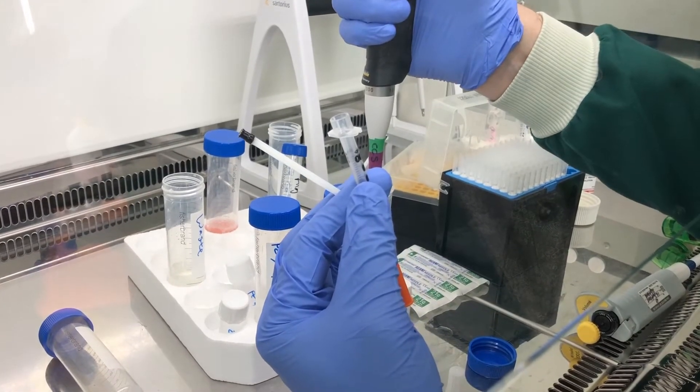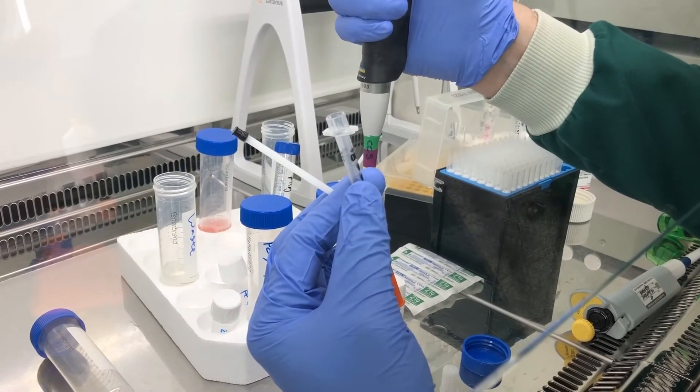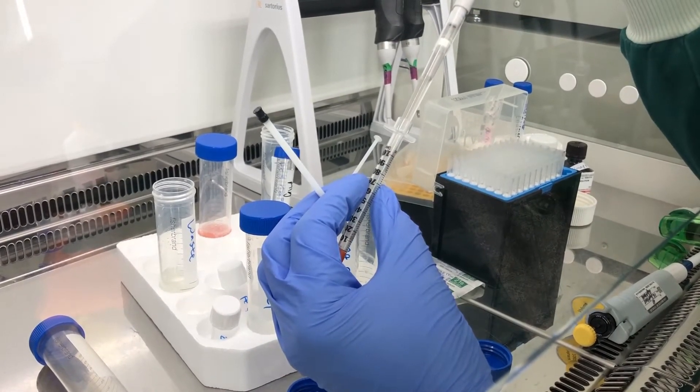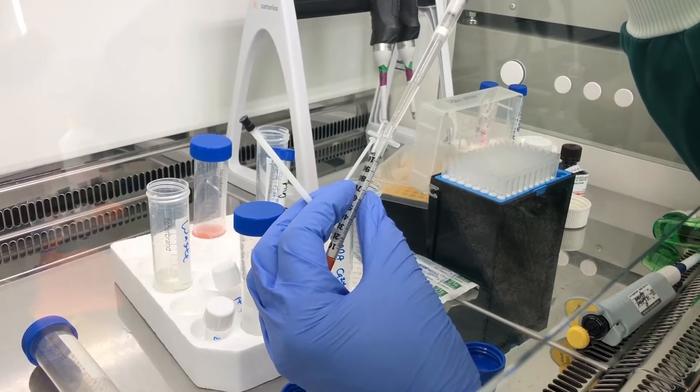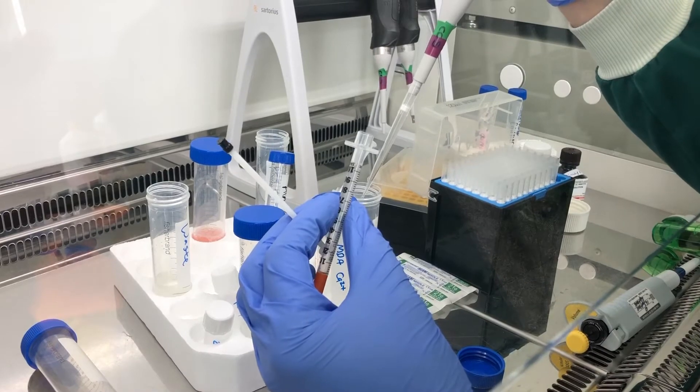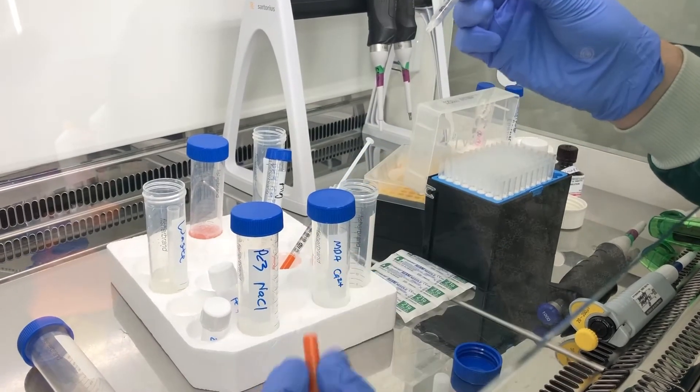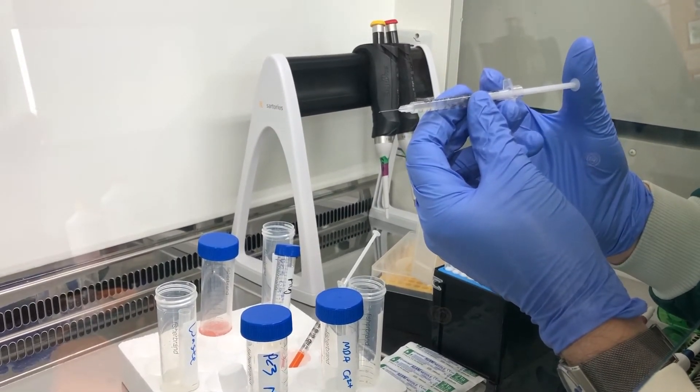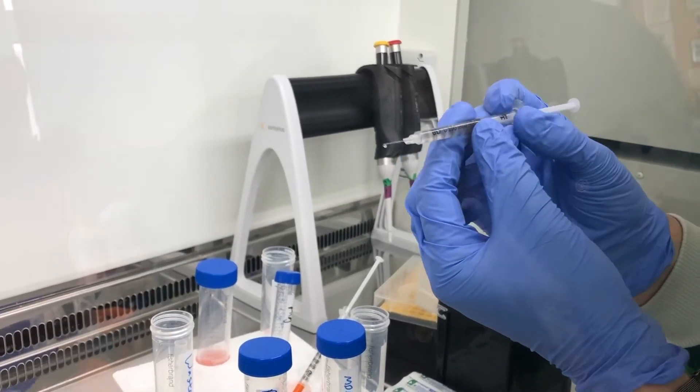And that's because if you try to draw the cells up through the syringe, you will kill them because it will create a vacuum. So I'm just going to pipette my cells down into the barrel. This can be a little bit tricky and you very rarely get a full one milliliter in there. So I just put a few hundred microliters in there. And then I can put my barrel in there, take off the sheath of the needle, and then basically push the alginate until it just starts to extrude out of the needle. You can see a tiny little drip of alginate there.